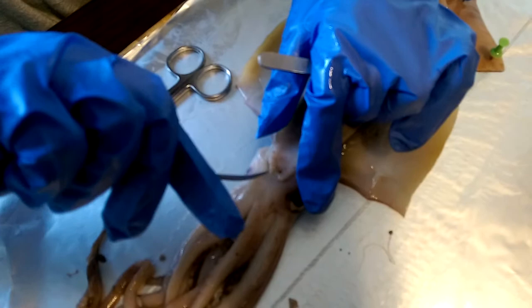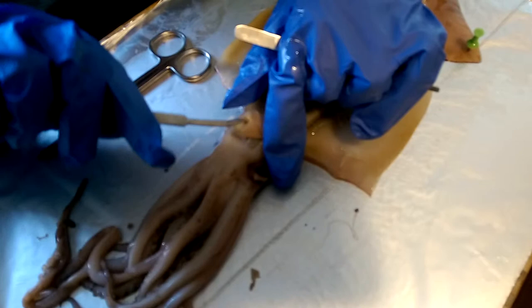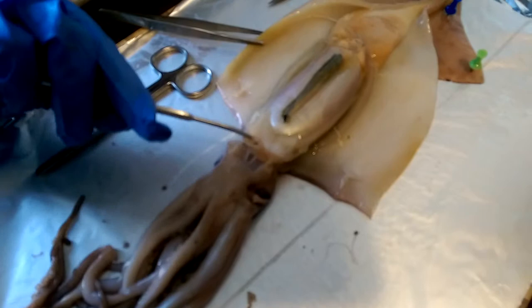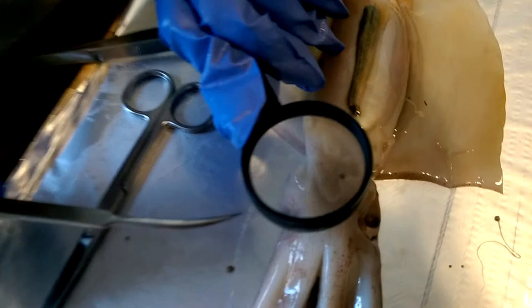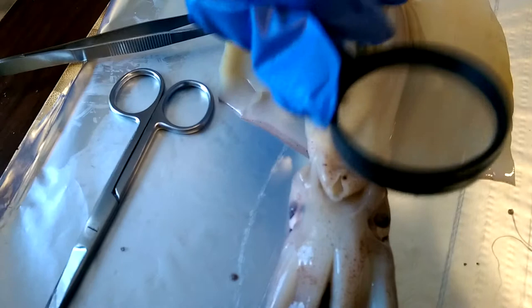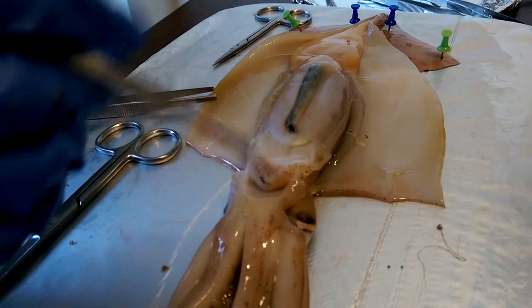Now I'm going to show you something. I just want to see the inside of it — let's try to find out how this looks inside. I did a little hole; I'm not sure if you can see anything, but if you do, tell me in the classroom. I see something bubbly — that could be the brain. Did you know the brain is actually here? Some people could imagine it's somewhere else, but this is where the organs belong, not the brain.